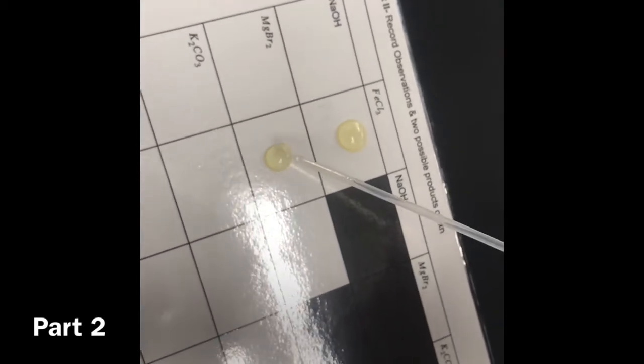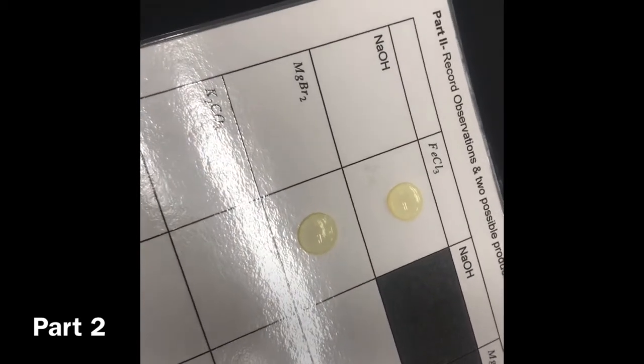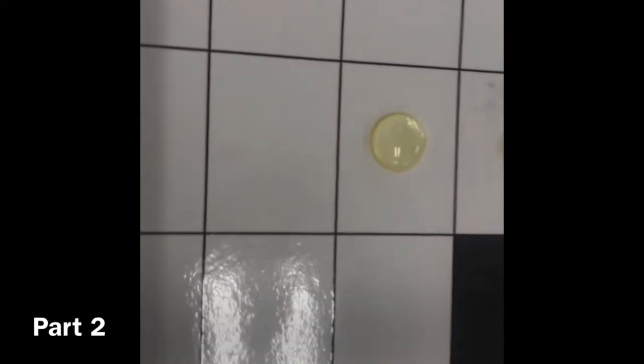Oh, the bubble went away. This will get really tricky if they all start. Alright, did it change at all again? Staying nice little circles. Will you hold this? I can't hold a vial and I can't. It looks like it once again did not change whatsoever. I'm gonna double check that this is what is supposed to be happening. I don't know if we're doing this right, but neither of these have changed whatsoever.